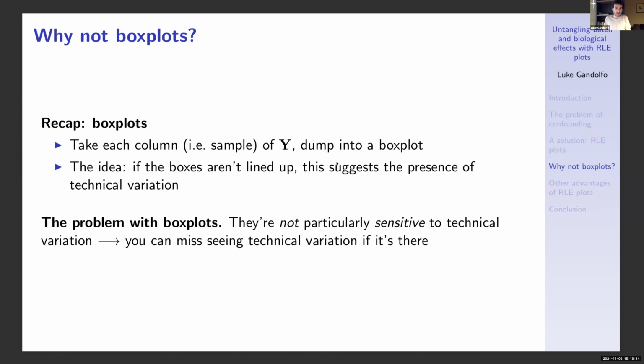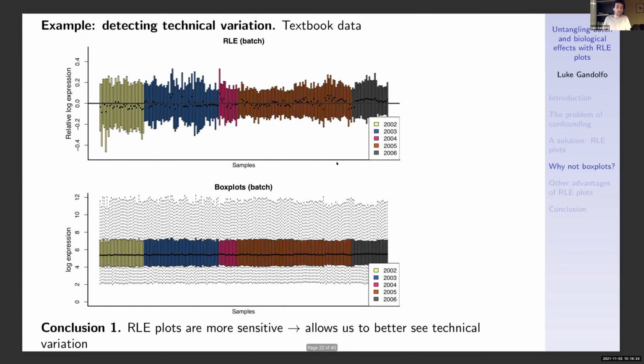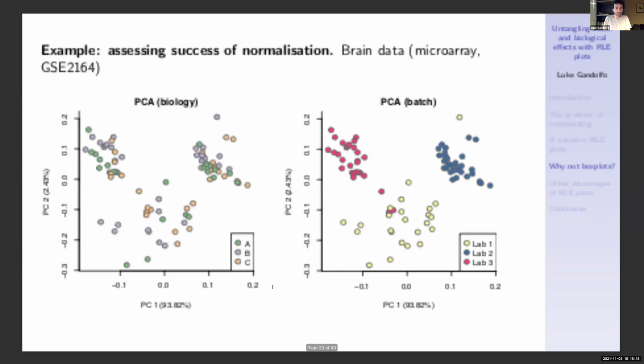Well, the problem with box plots is that they're not particularly sensitive to technical variation. And this can lead to missing our ability to see technical variation if it's there. So for example, if we're just merely trying to detect technical variation, for the textbook data, when we did an RLE plot, we saw significant technical variability. But had we done box plots, things look pretty good. Things look pretty nice. So in this case, RLE plots are more sensitive, and so they allow us to better see the technical variation here.